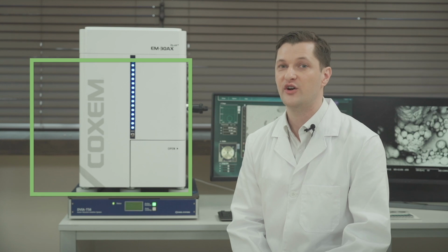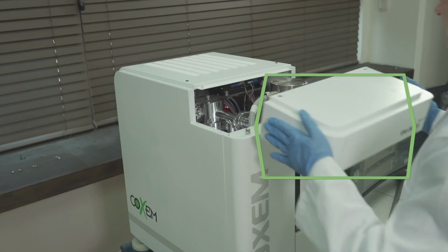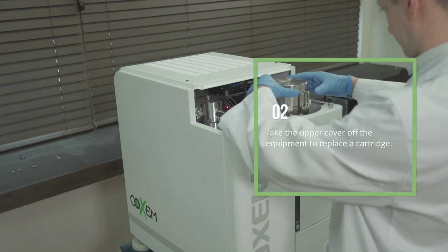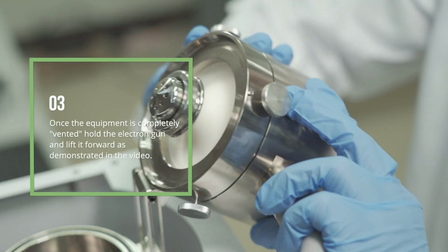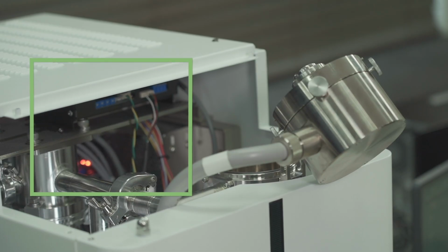1. Convert the pump mode to the vent mode. 2. Take the upper cover off the equipment to replace a cartridge. 3. Once the equipment is completely vented, hold the electron gun and lift it forward as demonstrated in the video.